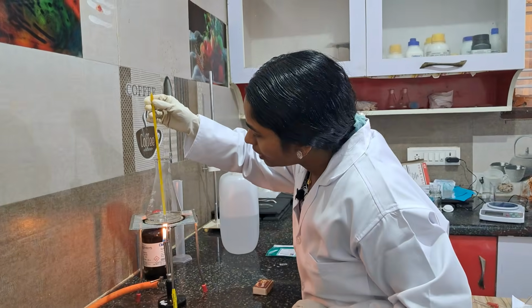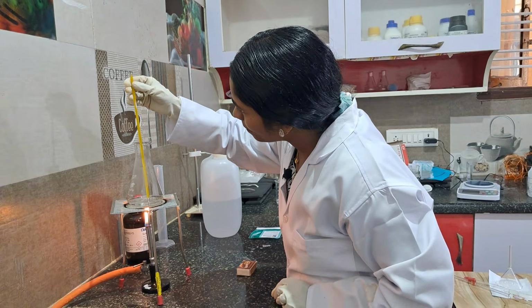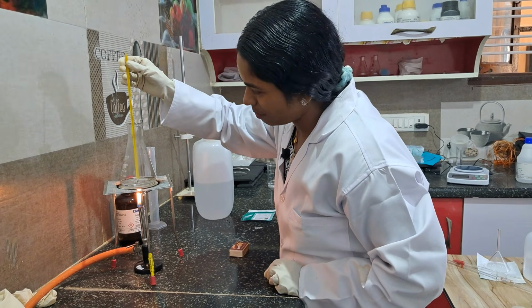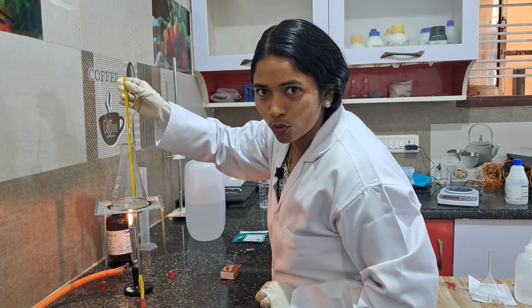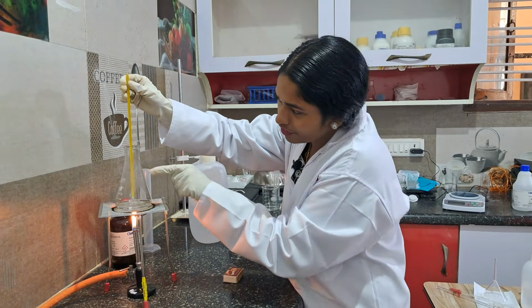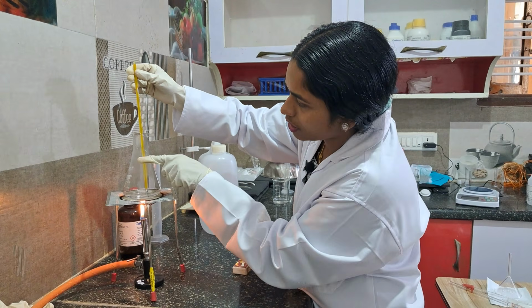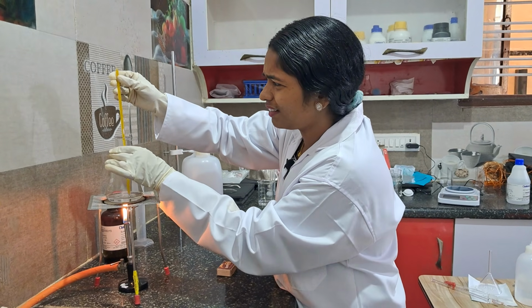Don't touch the thermometer tip down at the bottom. Just check and keep it a little higher, because with less solution, 10 ml, obviously it will touch. So take a little care, it may break, and there are chances if all the students are using it, so keep it a little higher. Now you can also observe around the conical flask, water bubbles have come. If you don't have a thermometer, you can hold the flask like this and check. No need to heat it so hot, a little bit hot is enough.